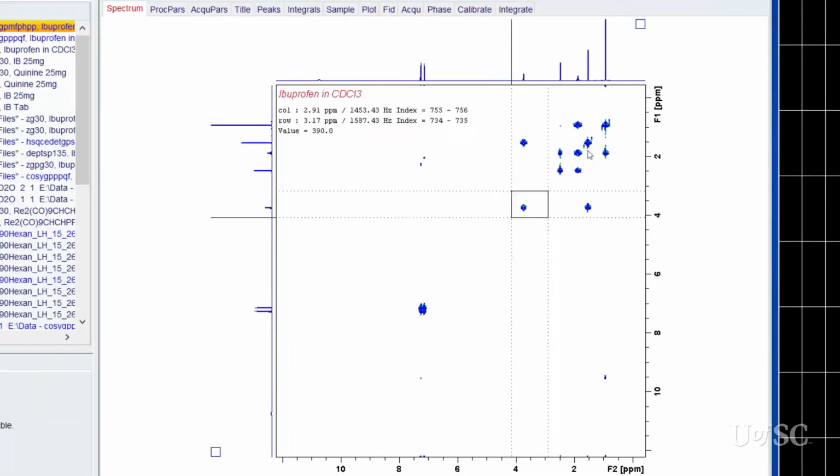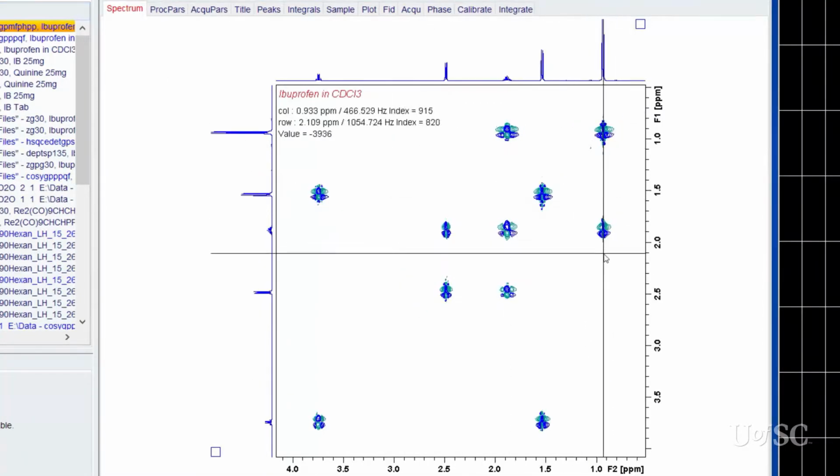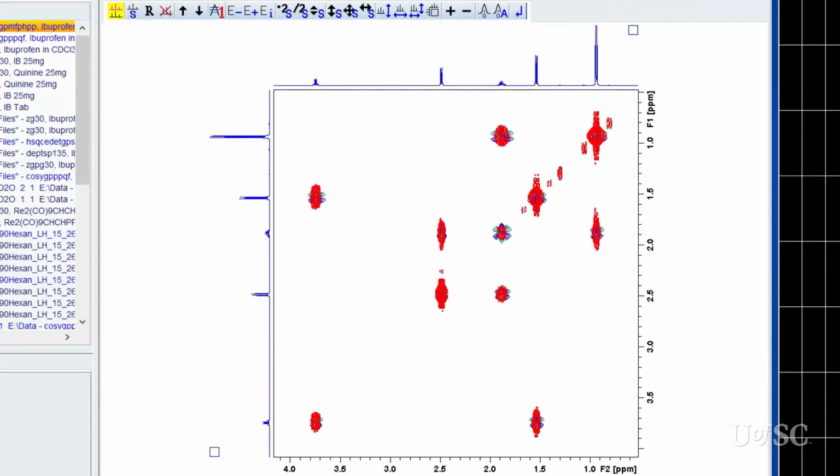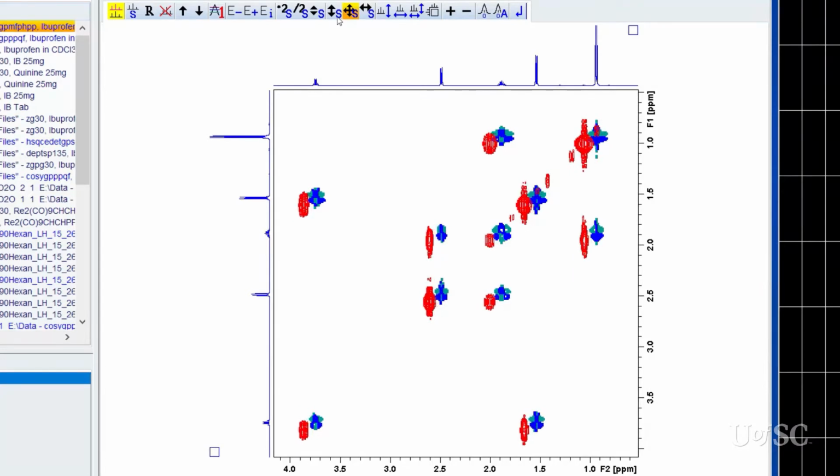The content of this experiment is similar to the magnitude experiment. If we enter multi-display mode, we can overlap the spectra to compare the two results. As you can see, the blue and green contours from the phase-sensitive double quantum filtered experiment are clearly narrower than the red contours of the magnitude experiment. This can offer an advantage, but the complexity of the phase-sensitive peaks can negate some of this benefit.